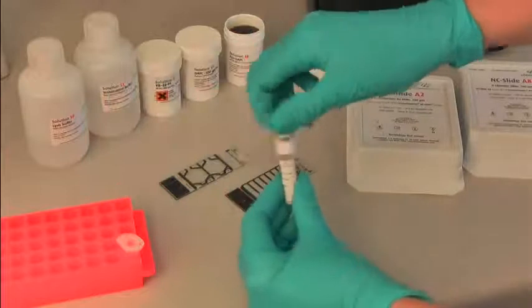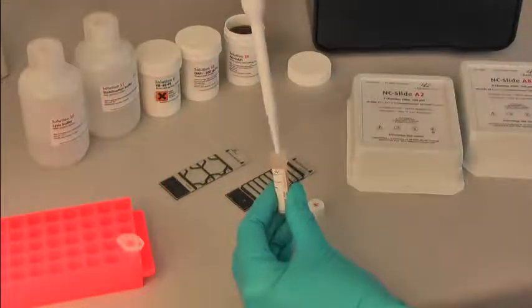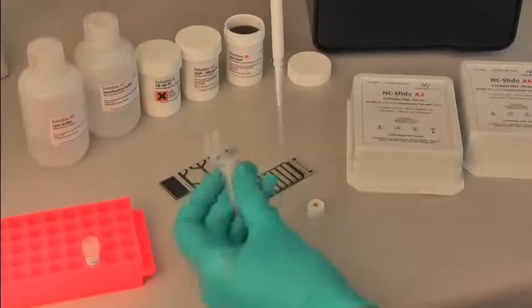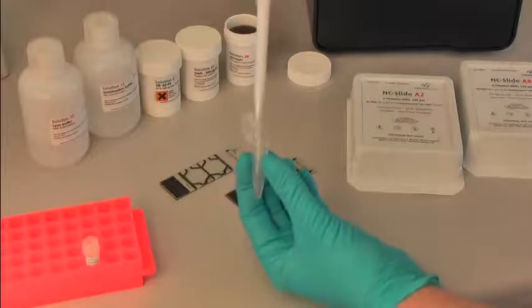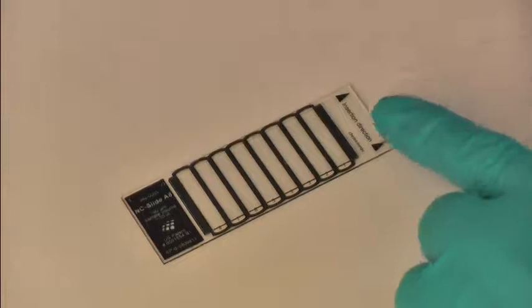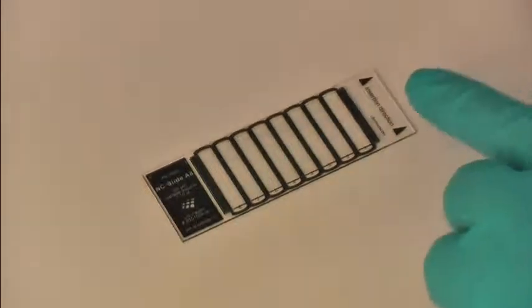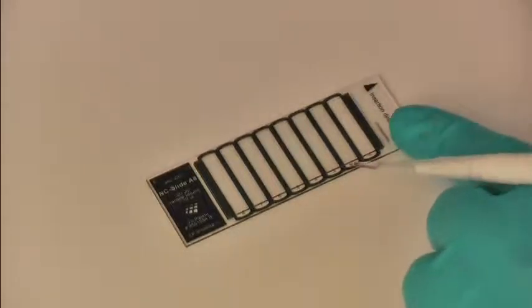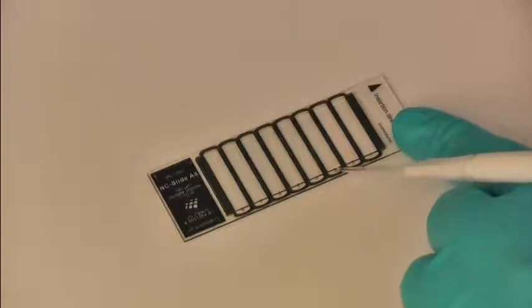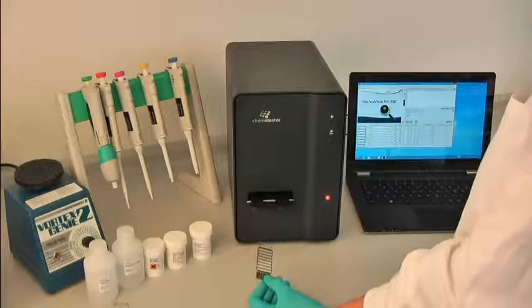Add Solution 18 to your cell sample and fill a slide. Insert the slide into the tray of the NC250 and press run.